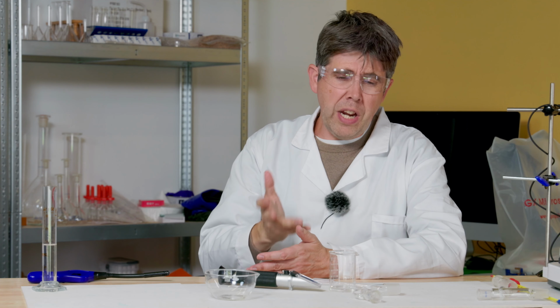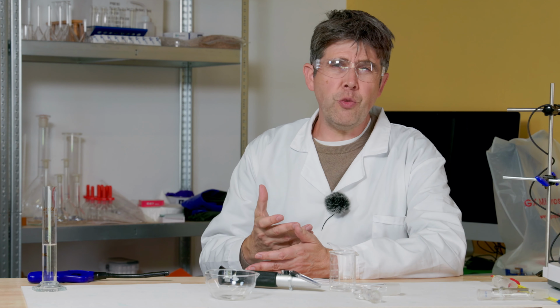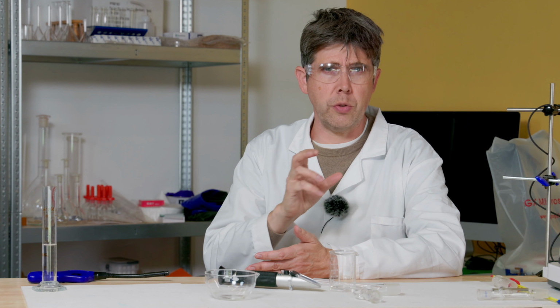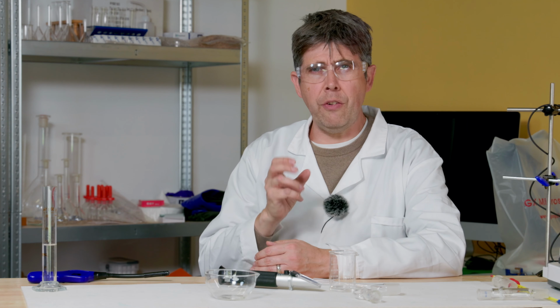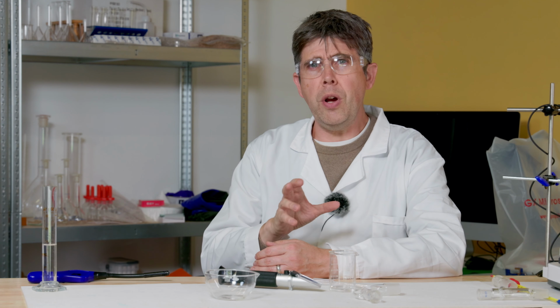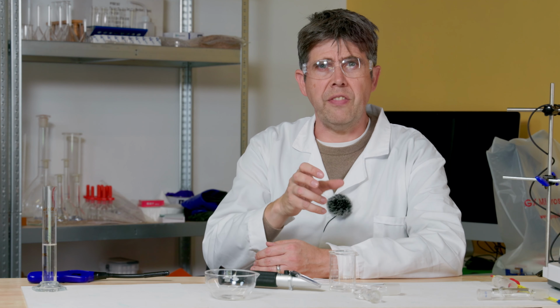So what went wrong? Well, nothing really. It's just that 78 degrees Celsius is very close to water's boiling point, and so a fair few molecules of water were in that vapour as well. And that's really just the limit of distillation. The fractions, that's what we call those separate components that we collect, are rarely pure unless their individual boiling points are very far apart.